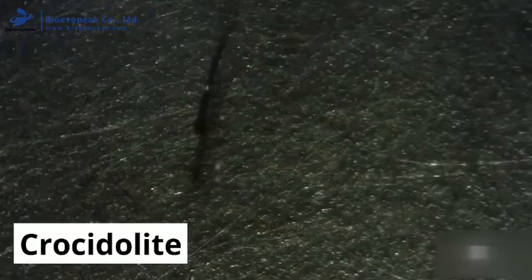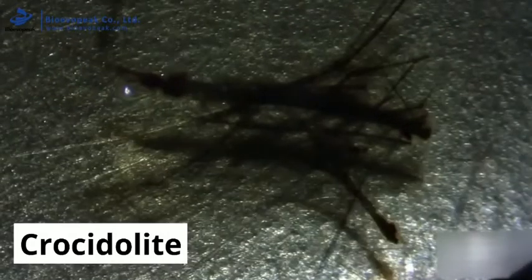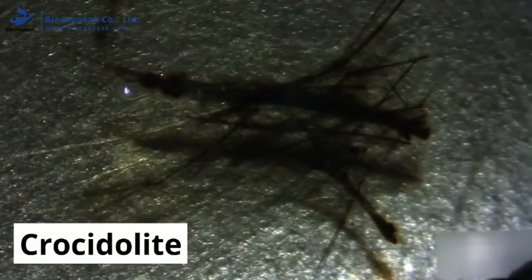The analyst places the prepared slide under the stereo binocular microscope and mounts multiple suspect fibres by lowering them into the liquid. After this, a cover slip is placed over the slide, and the slide can be brought out of the dust cabinet.